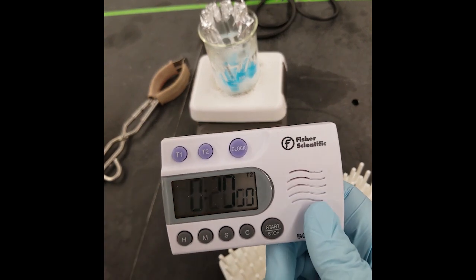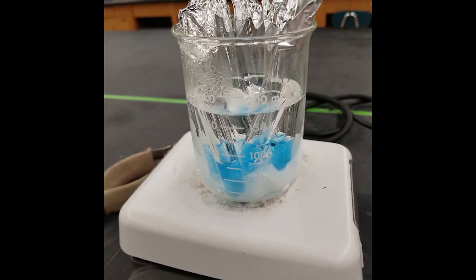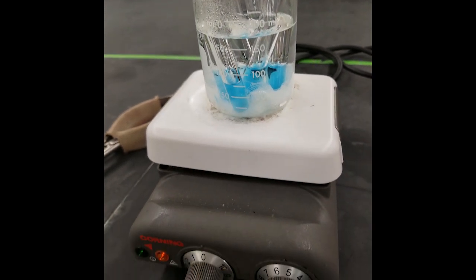You will notice that upon placing your samples into the beaker, the water will stop boiling because you've lowered the temperature with colder tubes. Resist the urge to dial up the heat on your plate when you begin heating your tubes.